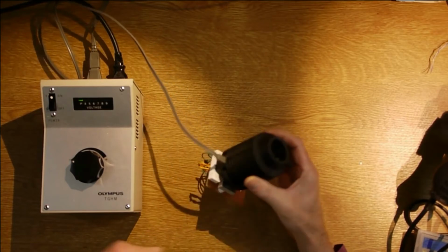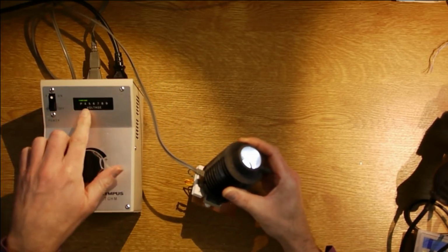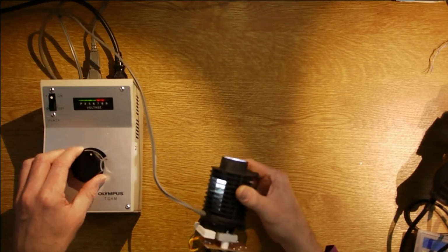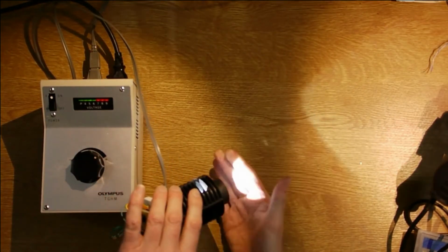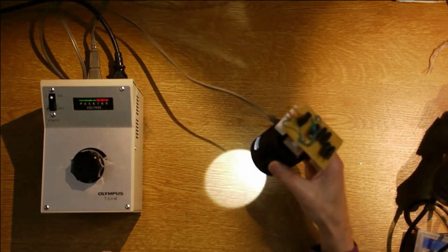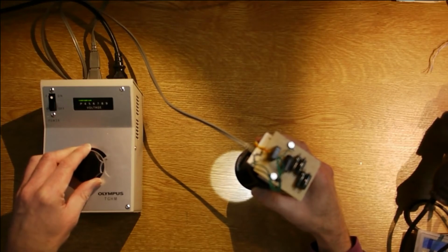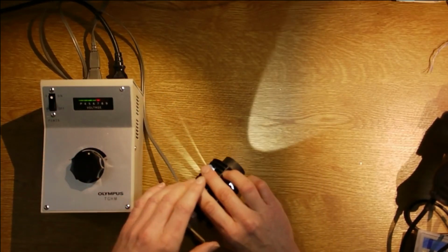That's the illumination. If I turn it up, you can see that the LED is on at just 4 volts at the moment, and that's pretty bright. And you can keep going, get brighter and brighter. You end up with a pretty strong illumination system, and you can see that it's a nice even illumination as well. I use it down here on 4, 5, 6 volts. Don't need to go to the higher voltage very much at all.